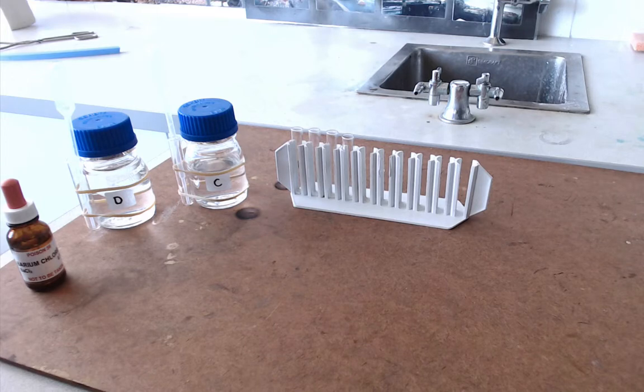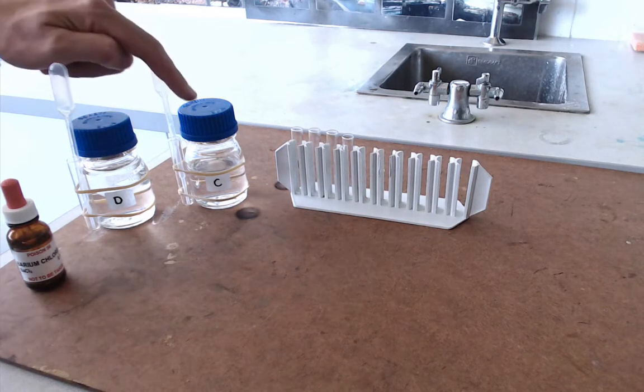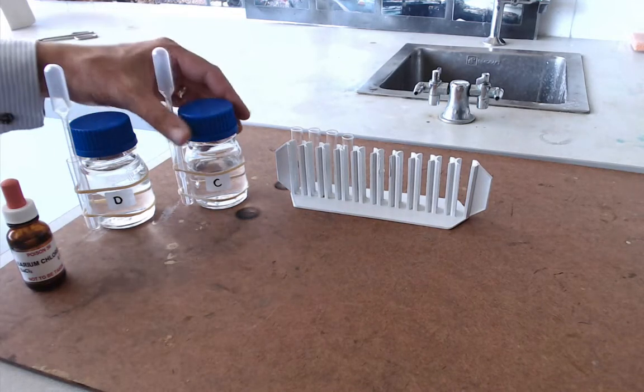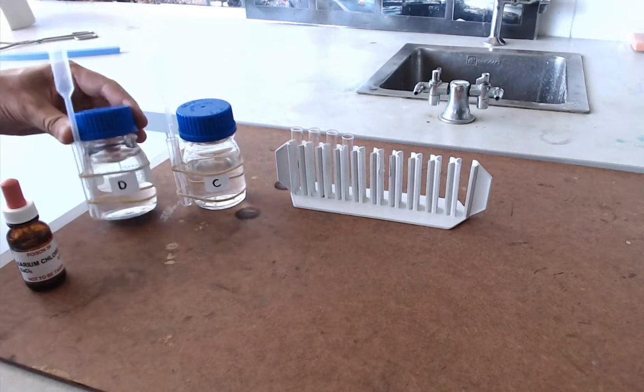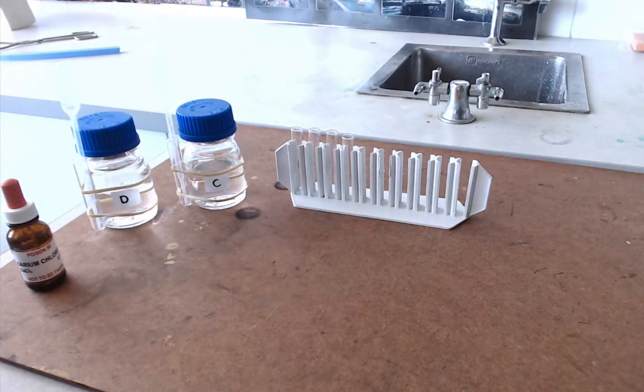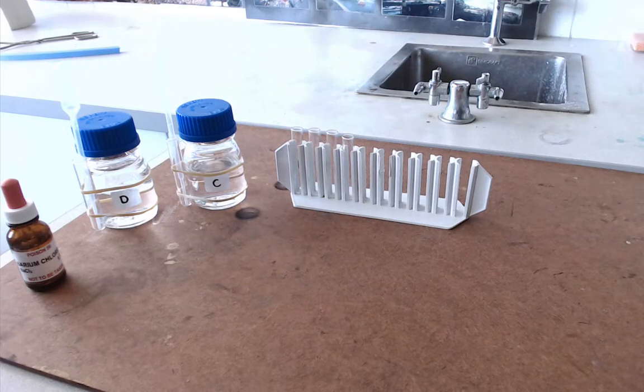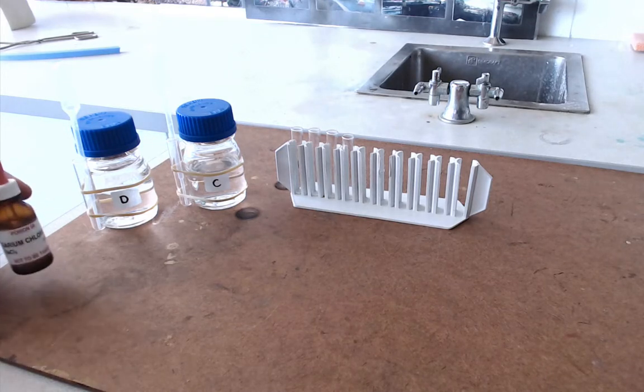They all work in the same way. They've all got two mystery substances to test. I've actually got C and D. The other pairs of substances are A and B, E and F, and G and H. Each of those pairs of substances has a different solution to test it with.